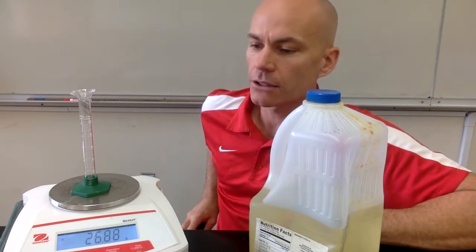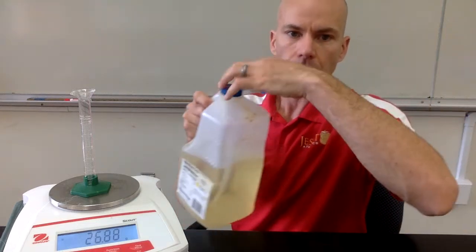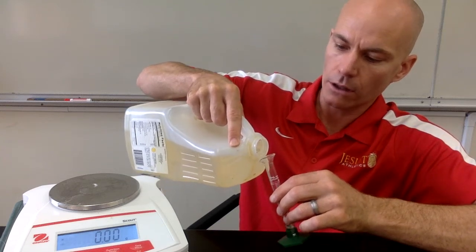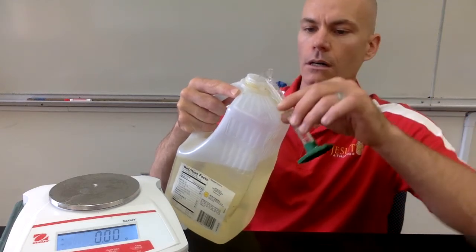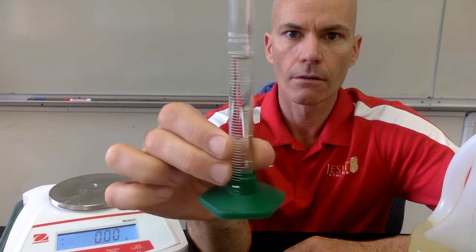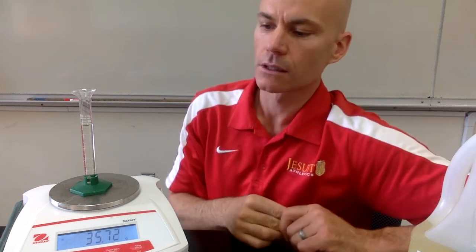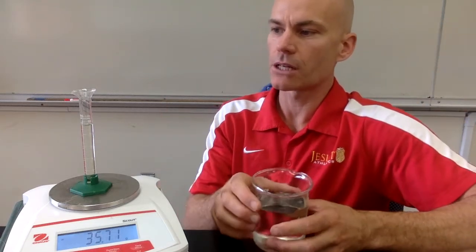Again, it has a slightly different mass just because this is a pretty accurate balance, and not all the graduated cylinders are exactly the same. And so we'll get the mass of the empty container, and then we'll add some vegetable oil to this graduated cylinder. And you can read the volume from the bottom of the meniscus. And then we'll put that on our balance, and you can look at the mass of the oil. And then once we've got the mass there, we can use that information to calculate the density.